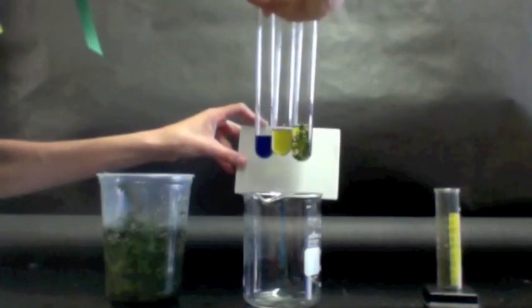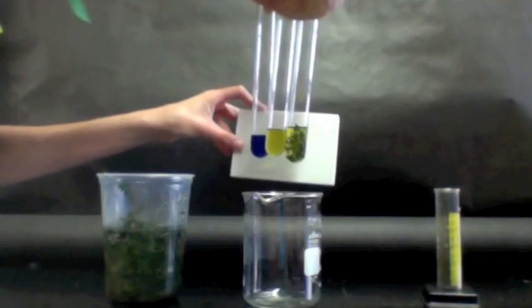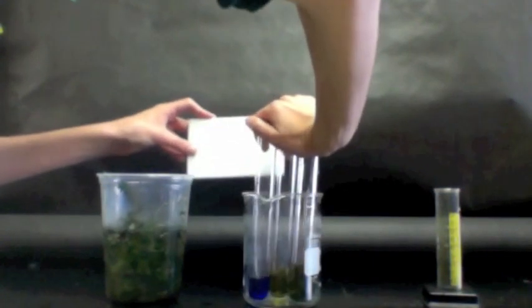What will happen to these colors if we put these tubes in the light versus if we put them in the dark? So we'll come back and look for that later.